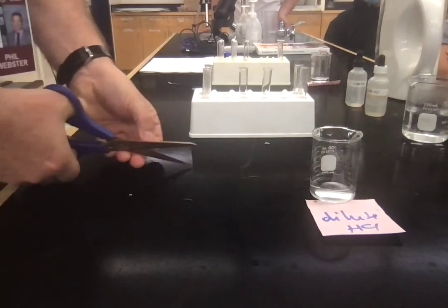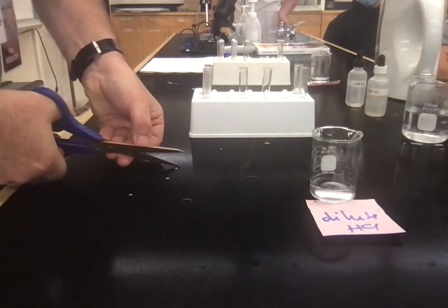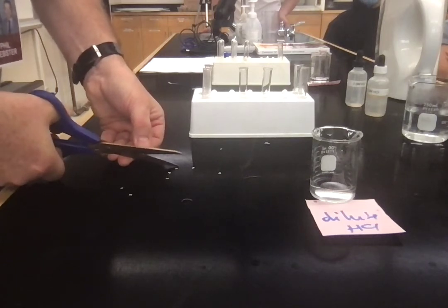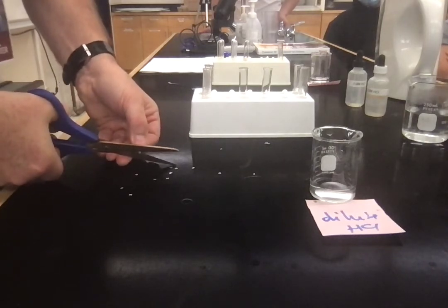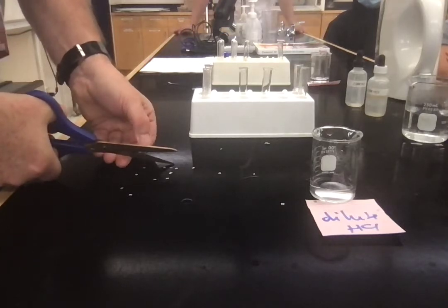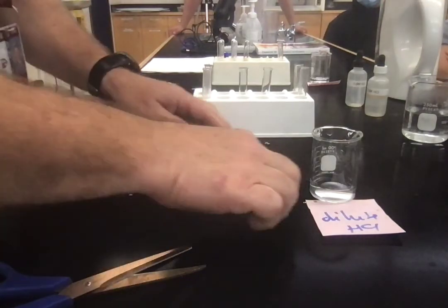I'm going to lose a few of these, I know, but I'm going to gather them up at the end. So, on the one hand, I'm going to have a little lump of magnesium, and in the other side, I'm going to have little bits of chopped up. This is like confetti. I'm going to give you a clue here. This is like kindling. There's more surface area.